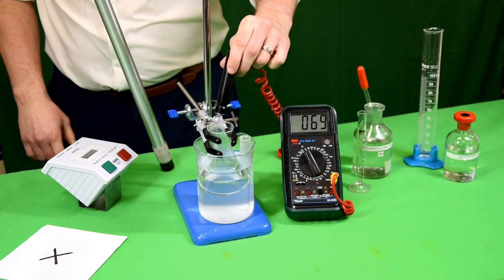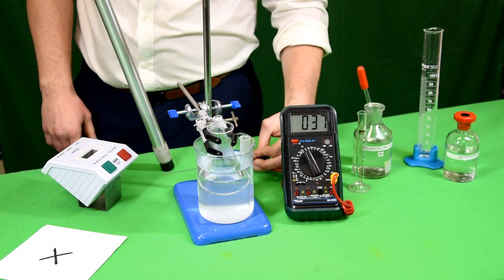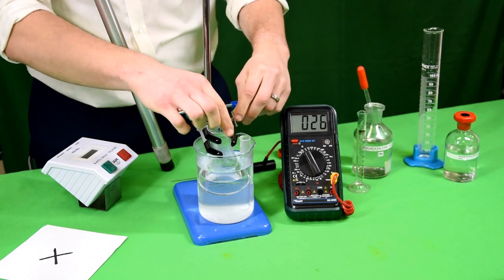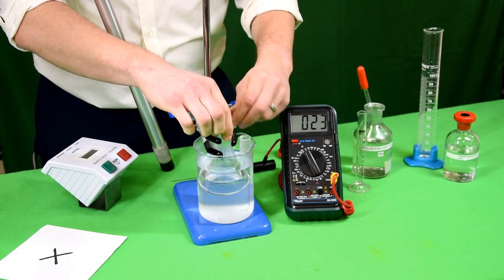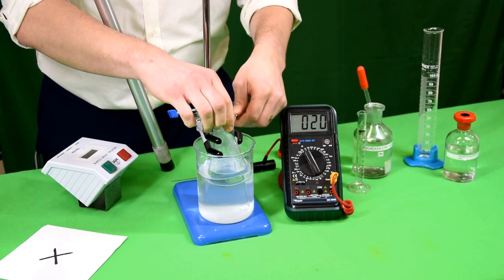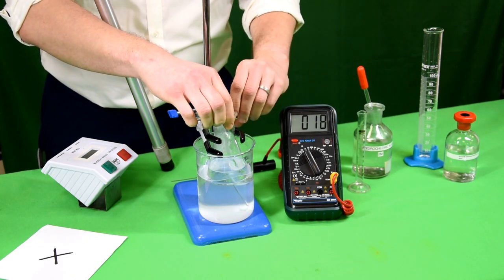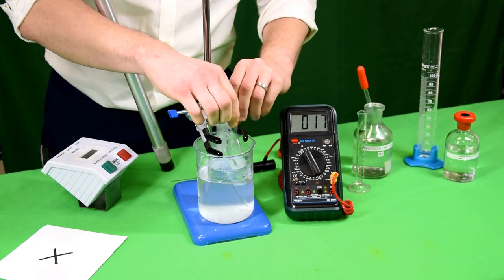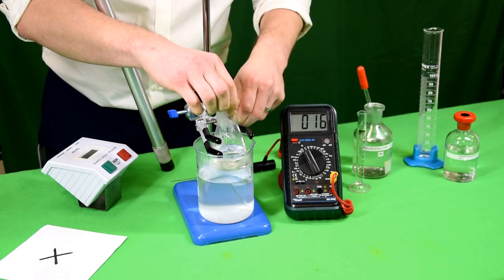The first reaction between sodium thiosulphate and dilute hydrochloric acid is going to take place at 70 degrees centigrade. The sulphur formed produces a cloudy yellow precipitate, and it is this precipitate that we're going to use to time the reaction — the formation of this precipitate.